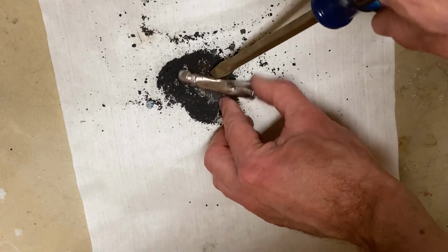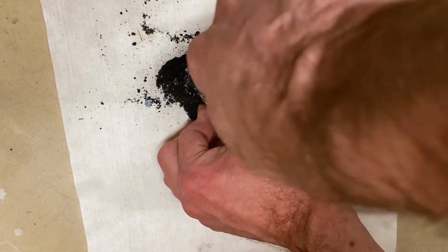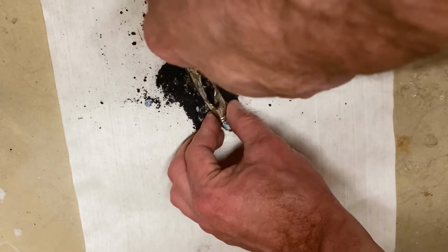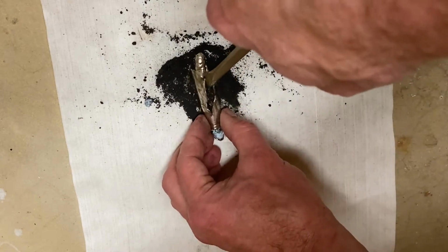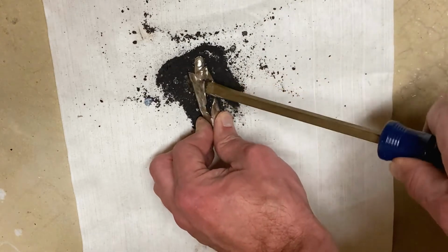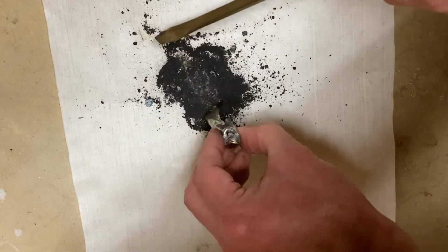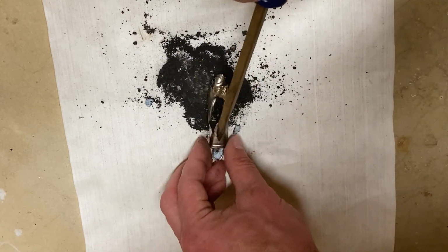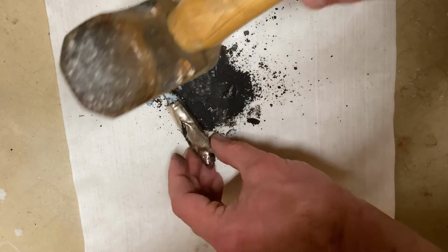Okay, so let's see if we can just pry open that a little bit more. Just get that metal to completely break, but I don't know. It doesn't look like it necessarily wants to. But I think at this point it can at least get to everything, so that's probably less of an issue. So nice if I could just split that little bit down there, or just let everything out like that. So I don't know, I guess this calls for a little more whacking on this.